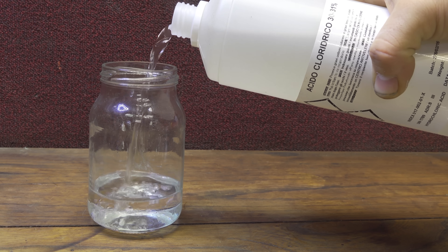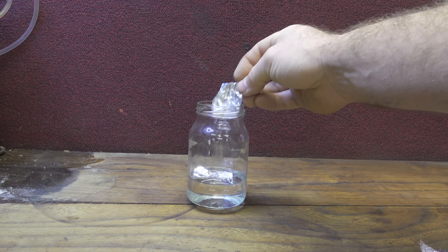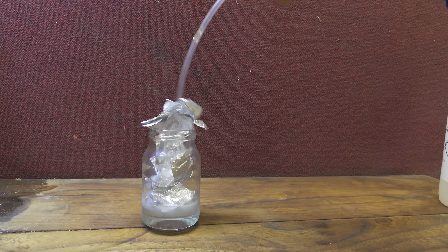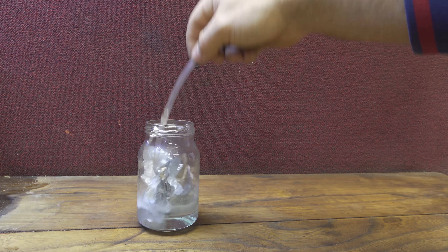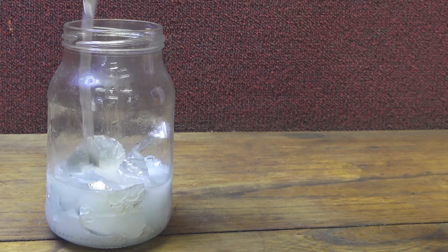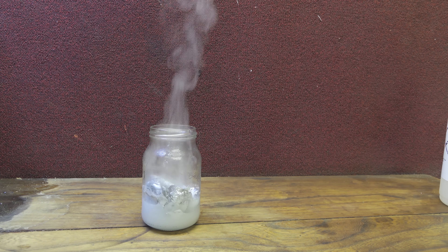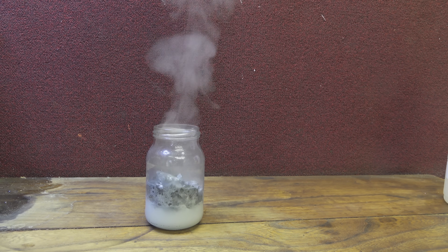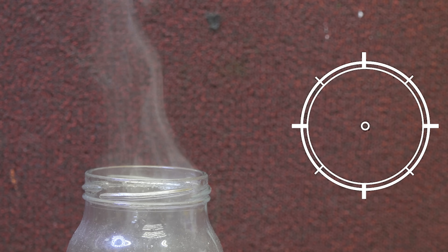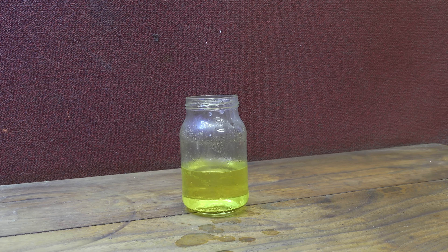Put the pieces on the table and drop a couple of fingers of acid inside the glass container. Now drop the pieces of tin foil inside the acid. Be careful — don't drop 100 grams all at once; instead put some pieces at a time. I push them with a plastic straw and you can already see that we have a reaction. The reaction is very strong, it will produce a lot of heat and a lot of smoke, so be careful — the glass container can explode and please don't breathe these gases. I'm wearing a safety mask. I let the container sit for about 24 hours and this is the result.